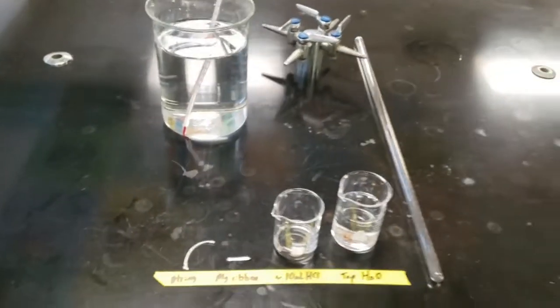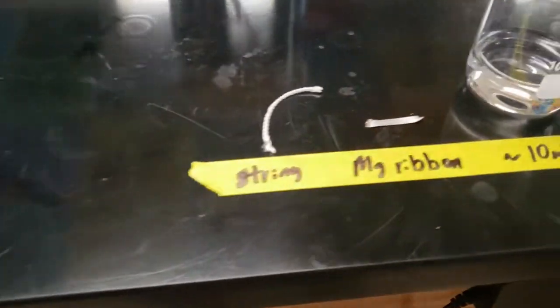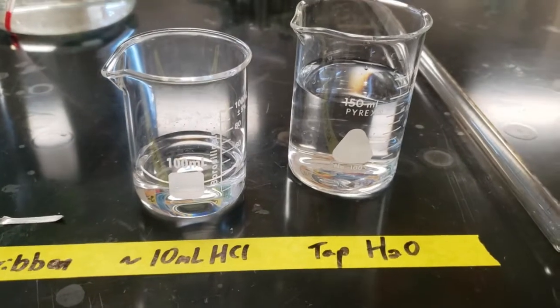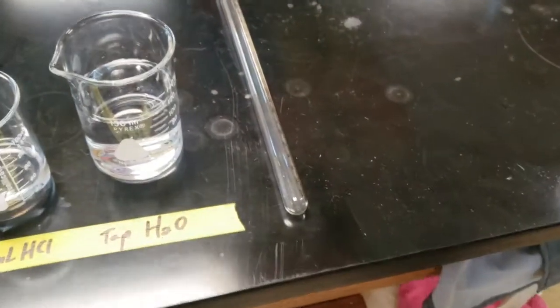Welcome to our Ideal Gas Law Lab. We are going to use a string, a piece of magnesium, some hydrochloric acid—it's going to be very concentrated so we have to be very careful—and just some tap water.